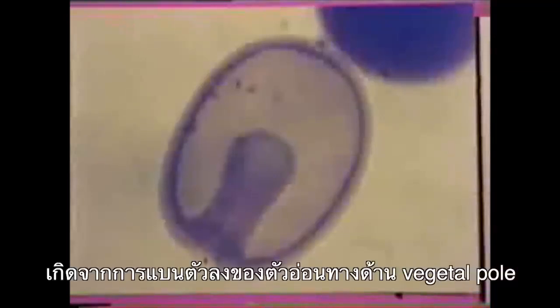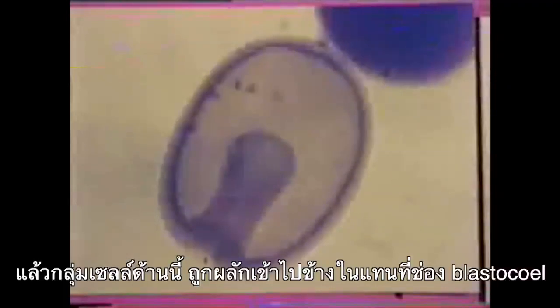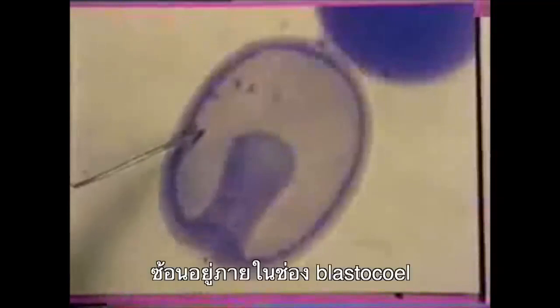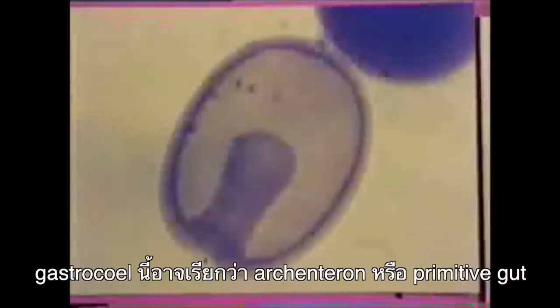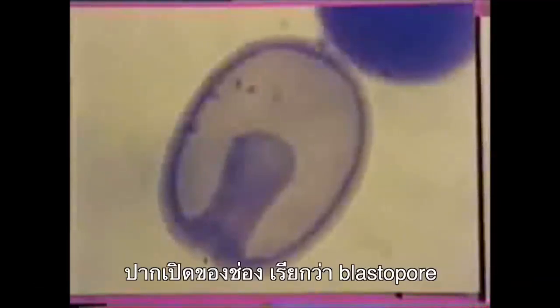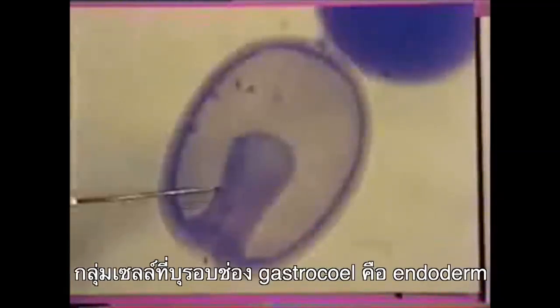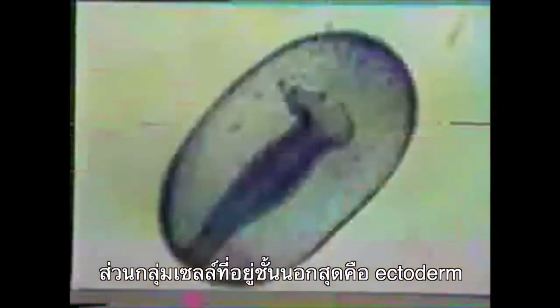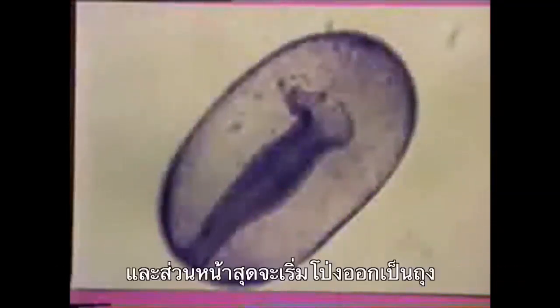The cells at the vegetal pole flatten and move inward. The cells get pushed inward towards the blastocoele in a process called invagination. This cell movement creates the gastrocoele inside the blastocoele. The gastrocoele is also called the archenteron or the primitive gut. The opening of the cavity is called the blastopore. The layer of cells surrounding the gastrocoele is called the endoderm. The cells that remain on the surface of the embryo become the ectoderm. As the embryo continues to grow, the gastrocoele elongates and the tip begins to expand.